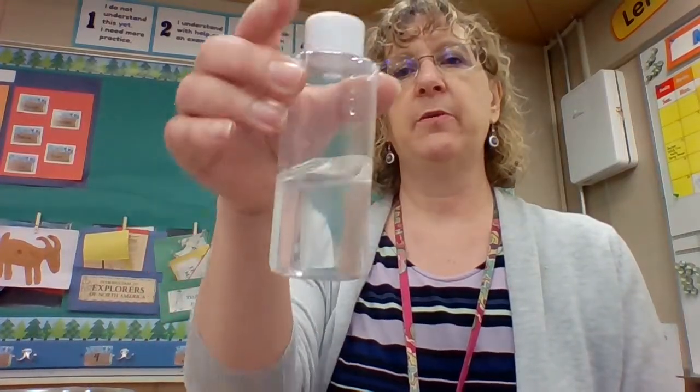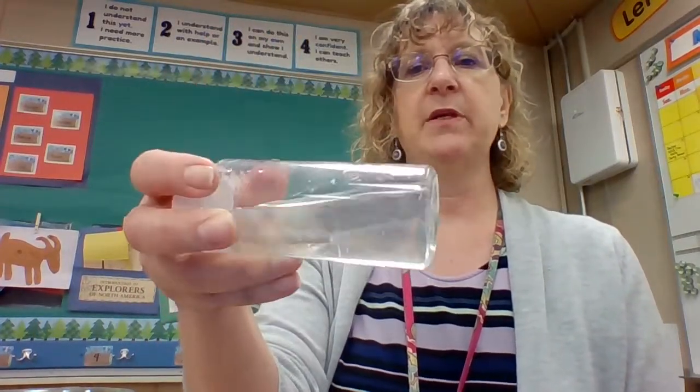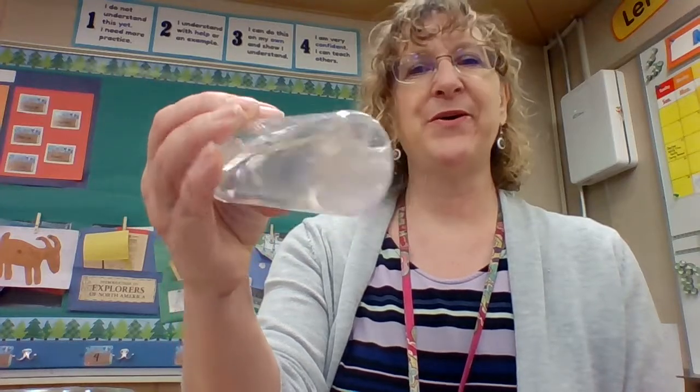All right, I've finished shaking, and it's pretty well distributed, as you can see. Can't really see any more in the bottle, so I'm going to add another big scoop. So this is 2 big scoops. And drop it in through there, and put the lid back on. Shake it up. There we go. Be back.